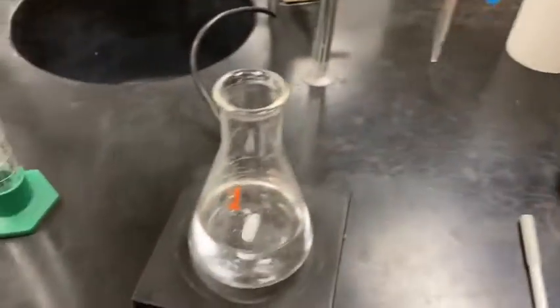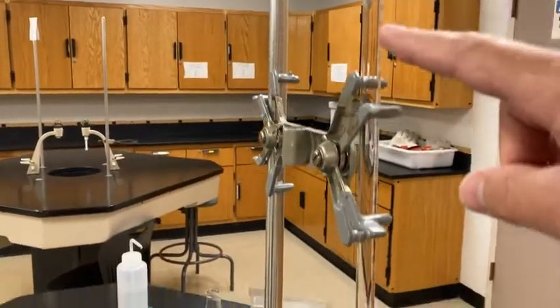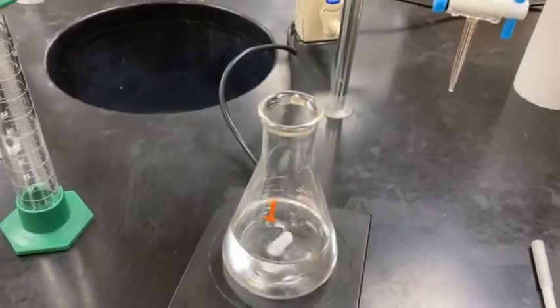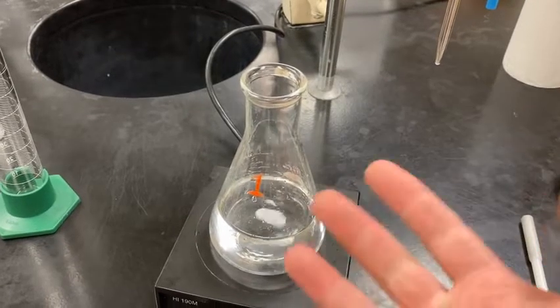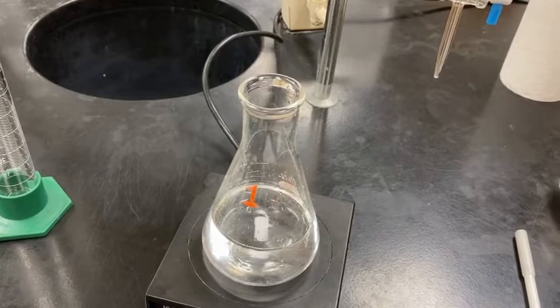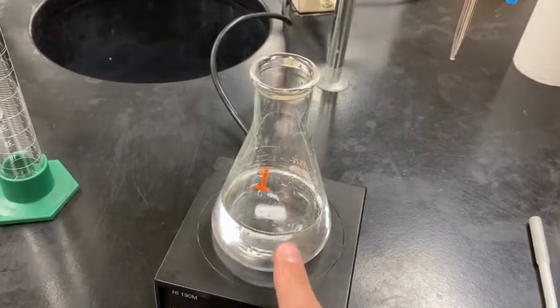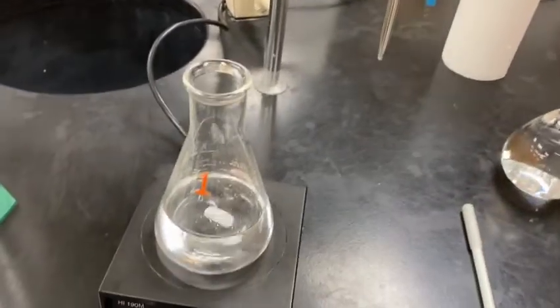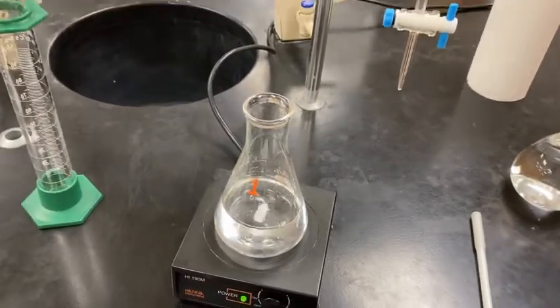And when I titrate today, as I'm adding the base through this column called a burette, it'll drip out the bottom into my flask. When I start to see the lightest of pink kind of pervade, then I know that I've reached the point where the moles of acid that I have dissolved in here should be equal to the moles of base that I've added from the burette. And that's when I stop titrating, and that's what we call the end point.